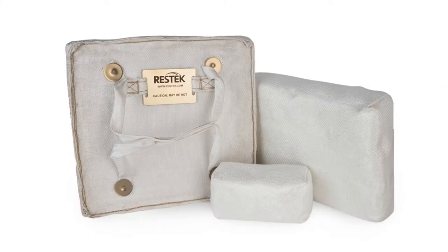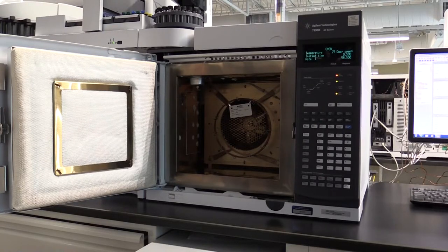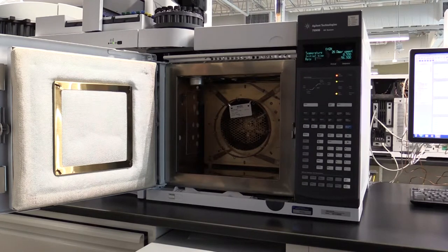The Restek GC Accelerator Kit has been designed specifically to work with Agilent 6890 and 7890 GCs equipped with mass spectrometers. The accelerator will fit in GCs equipped with other detectors mounted in either the front or back positions of the GC.